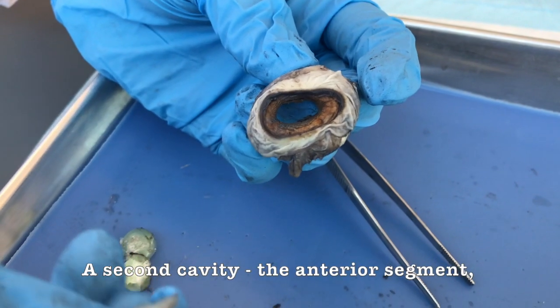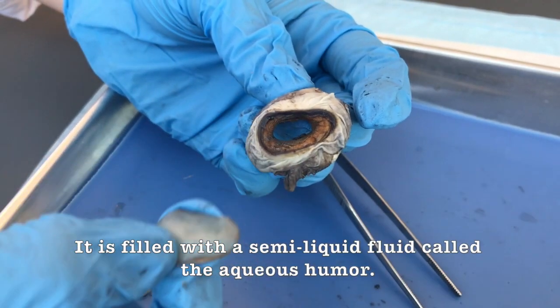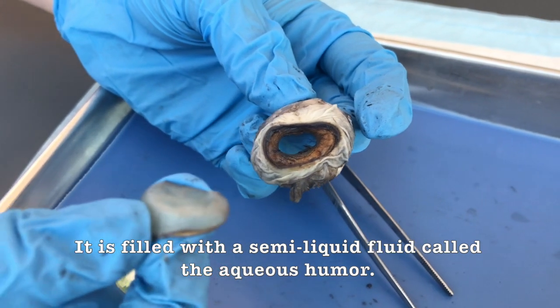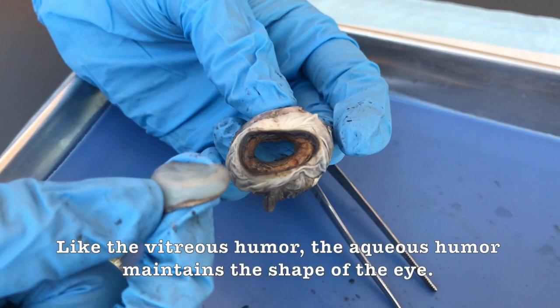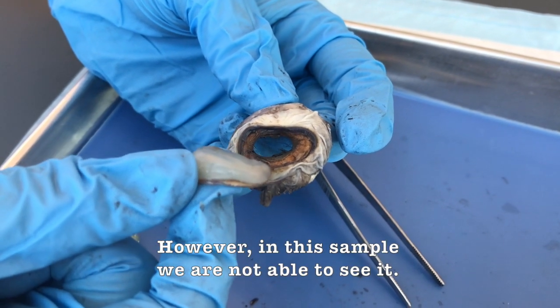A second cavity, the anterior segment, is present between the iris and the cornea. It is filled with a semi-liquid fluid called the aqueous humor. And like the vitreous humor, the aqueous humor maintains the shape of the eye. However, in this sample, we are not able to see it.